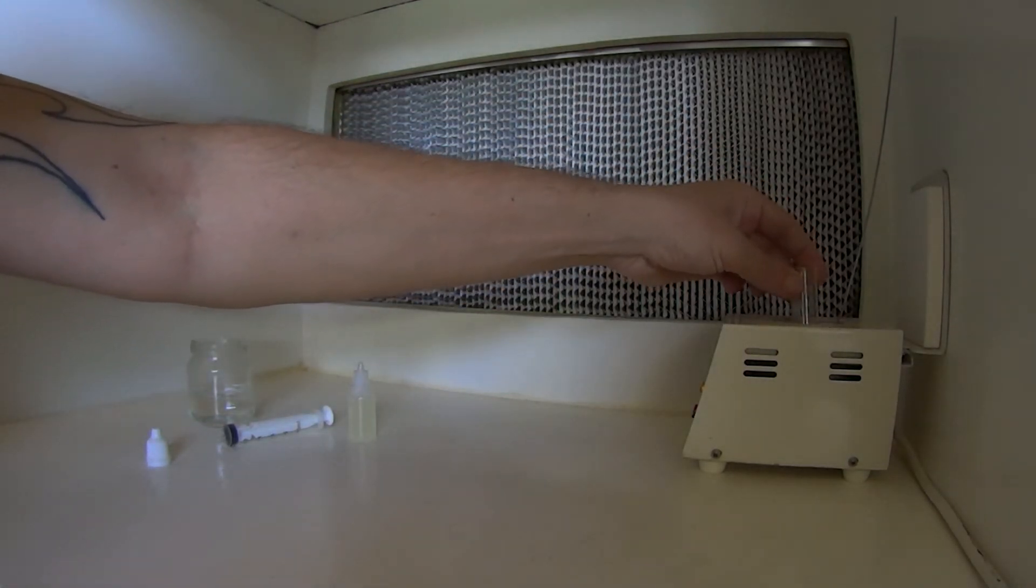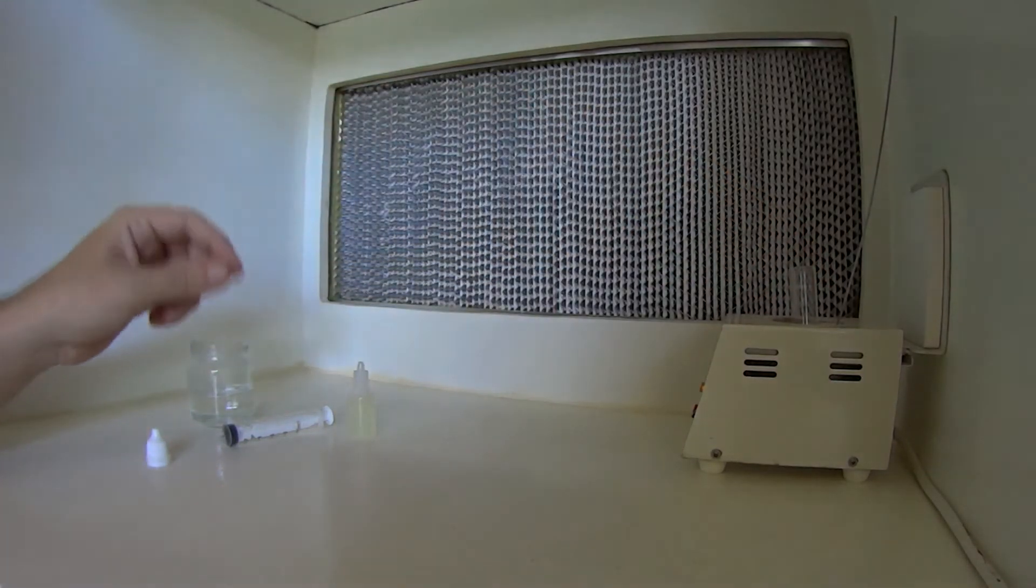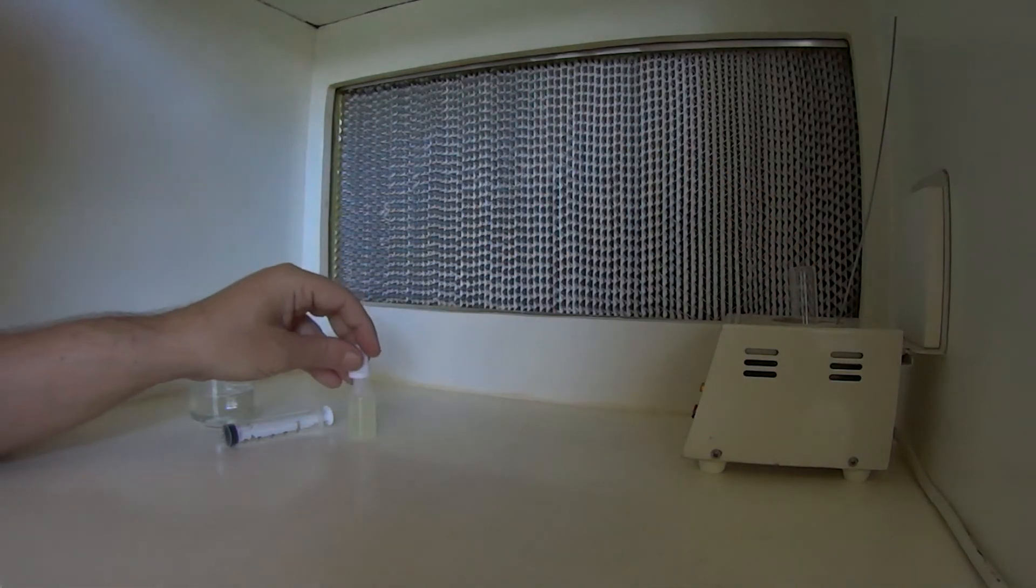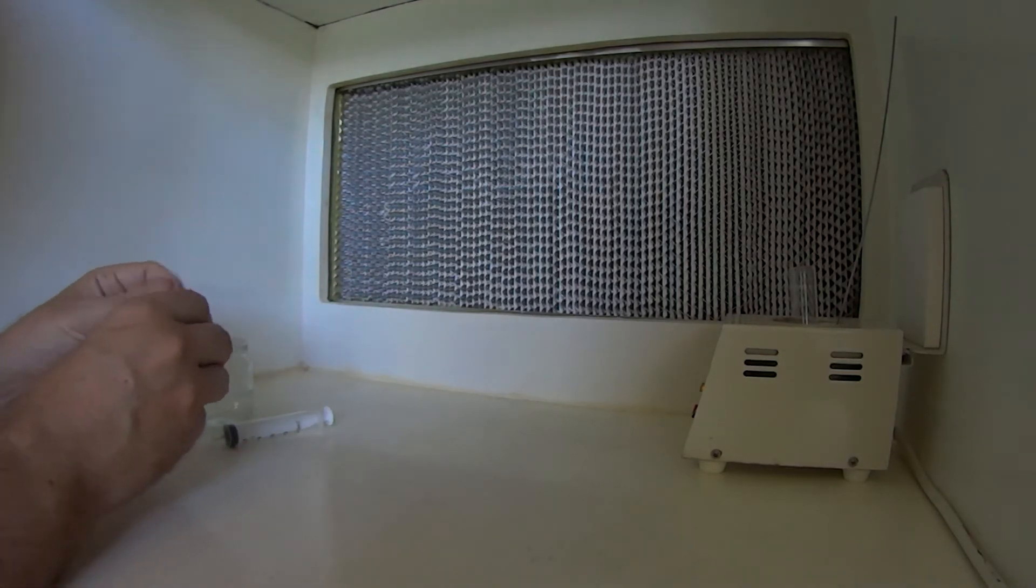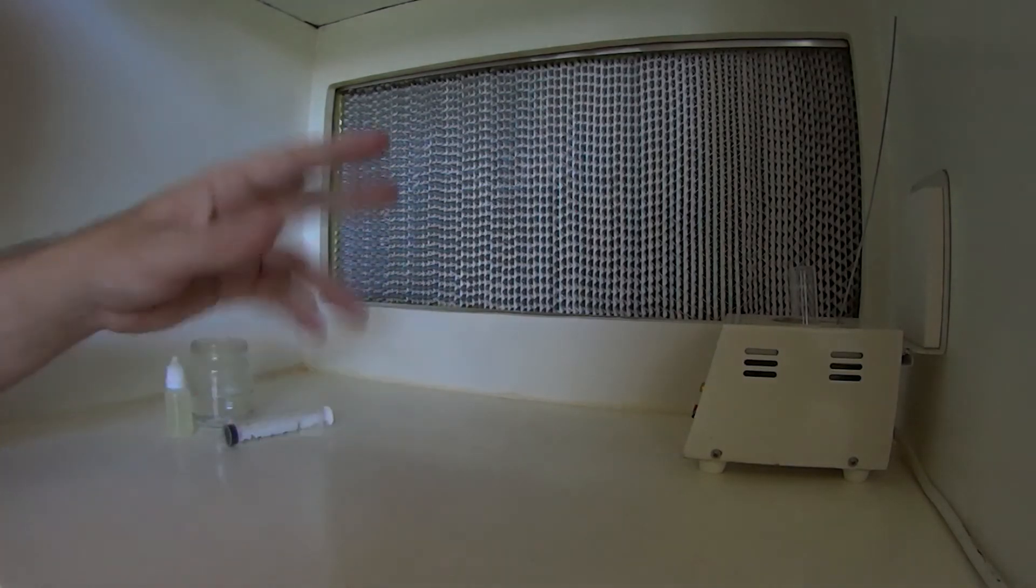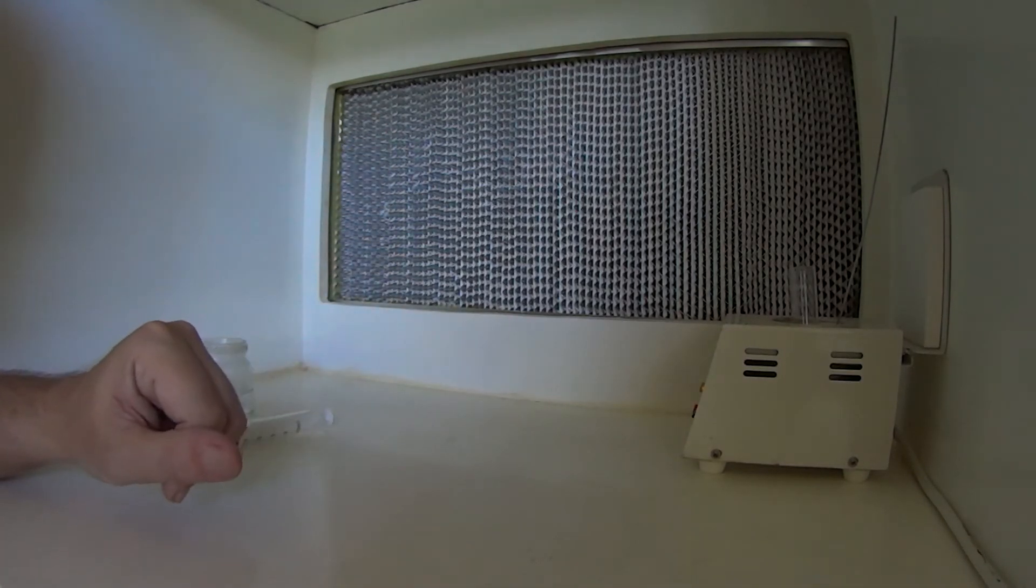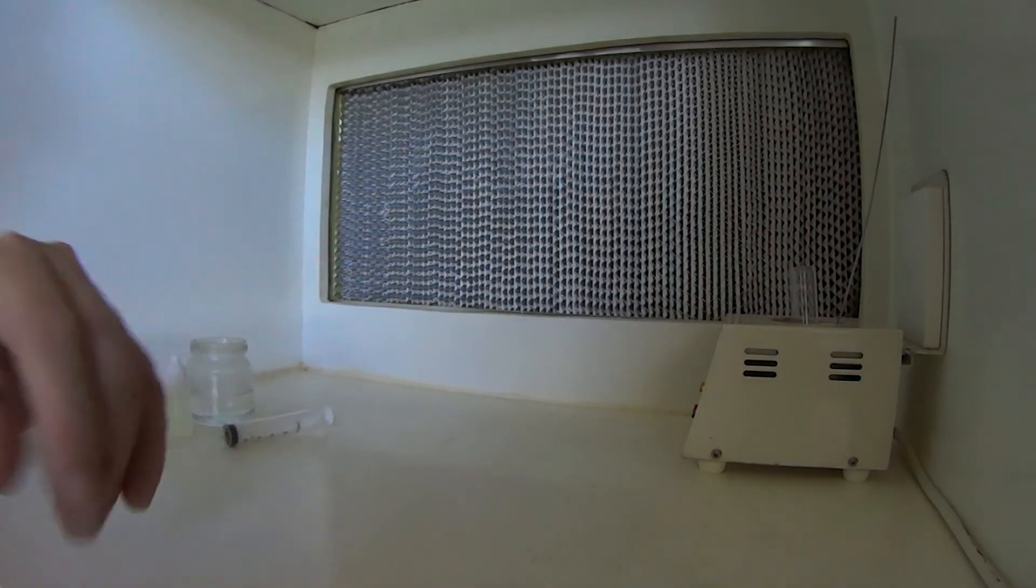It will take a few minutes in this glass bead steriliser so we'll just leave it sitting there. You can also heat it over a flame, some sort of flame cigarette lighter if you really can be bothered sitting there for a while. So what we do, once it's heated up and dissolved, we'll simply add some hot water to it. We'll just go and pause this for a while.